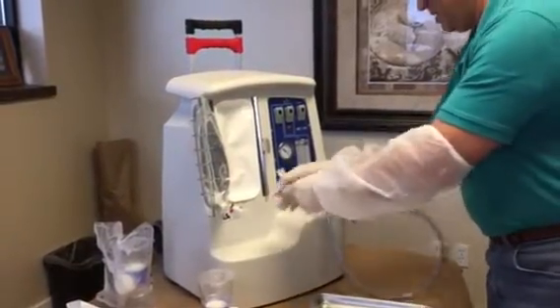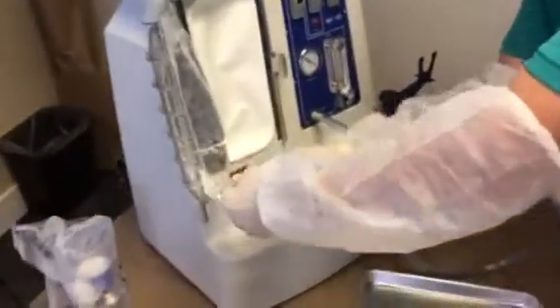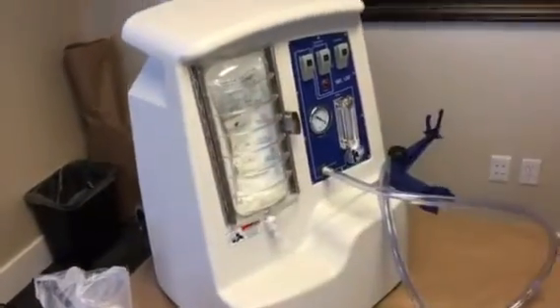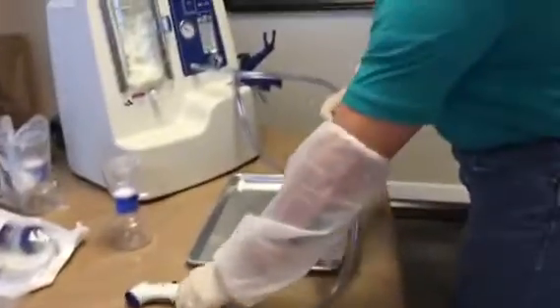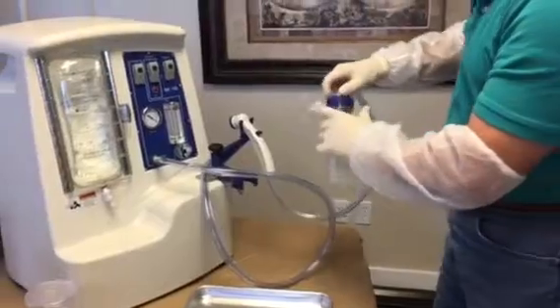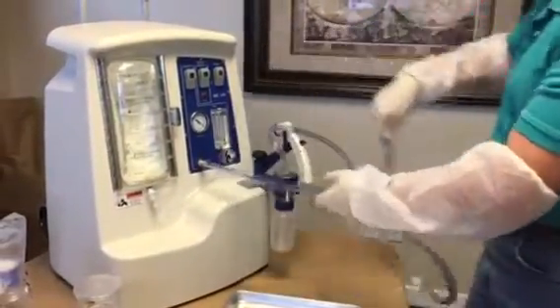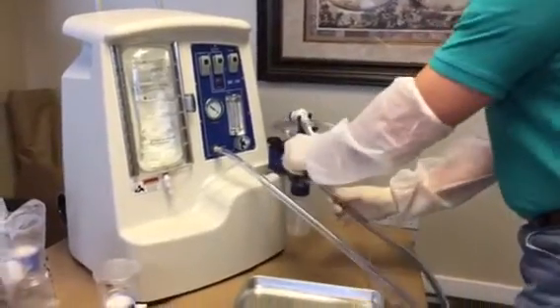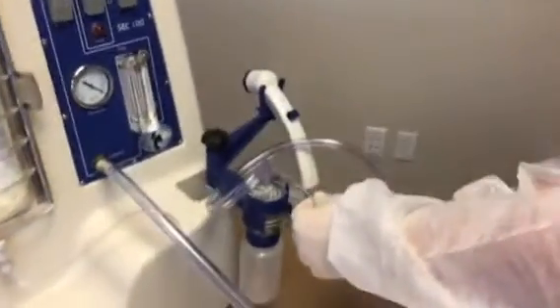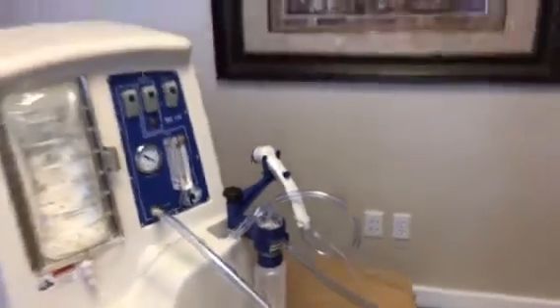This is a quick connect. I connect the bag right here — a little tug — close this door, open up the MVAC, hang this right in here, tighten it up, take this extension tubing, hook up there and there, and that's it.